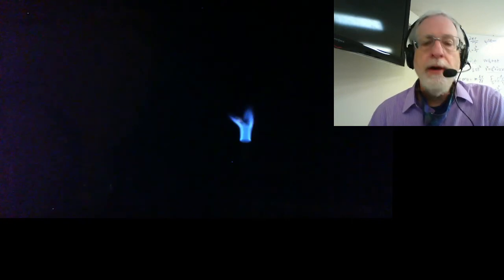Now we're going to go to potassium chloride. And remember, you can always rewind or pause the video if you need to. Potassium chloride. So here's potassium, KCl. And this one, if I remember right, there was a good spot in the middle that really showed the color of this one. Because this one was actually really hard for me to get a good color because that's the splint actually catching on fire in this one, and it happened every time.